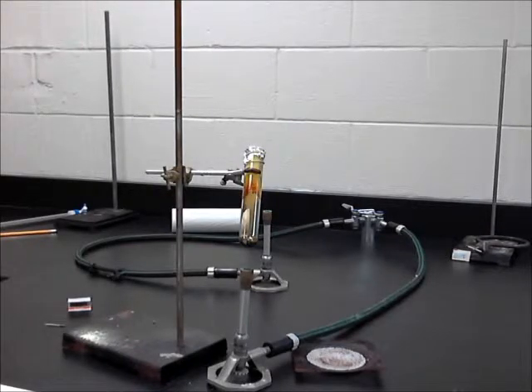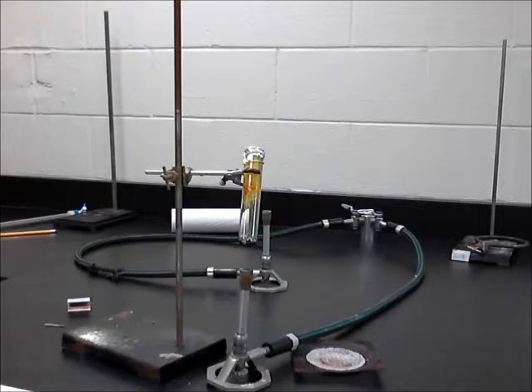So number 7 says heat the test tube using the Bunsen burner. Number 8 says notice changes that are occurring and record them in the table in your section. Number 9 says the reaction is done when no further changes are occurring. After the reaction has taken place, allow the test tube to cool. Number 11 says gently tap the test tube upside down onto a piece of paper towel which is on top of your notebook. If the substance is stuck, roll the test tube in a piece of paper and crack it open with a blunt object. See picture.